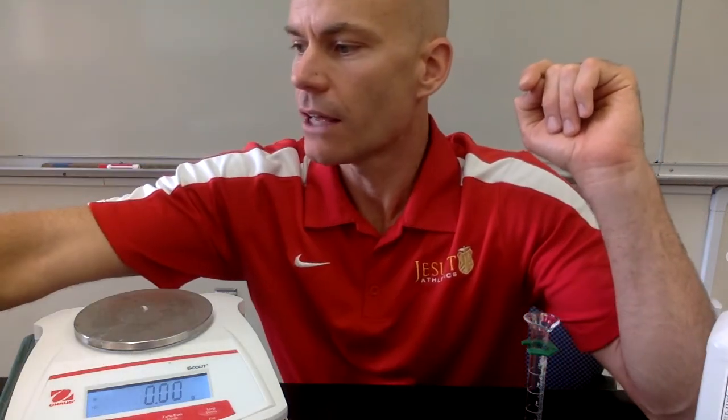All right, so that's the data you guys need for the liquids. Record that stuff in your data table. Go back and pause the video if you need to, and I'll make a separate video for the solids in this lab.